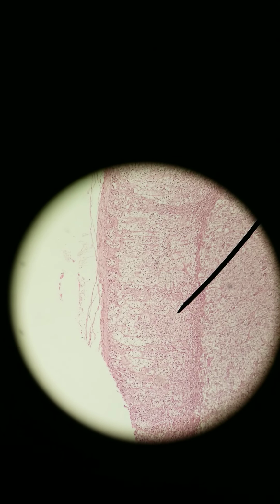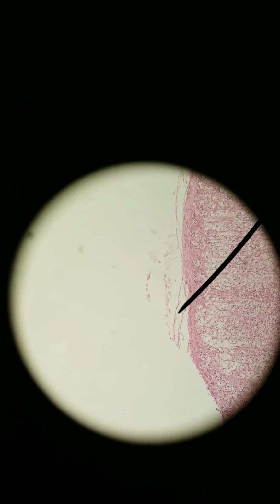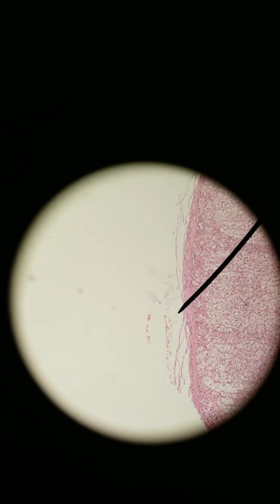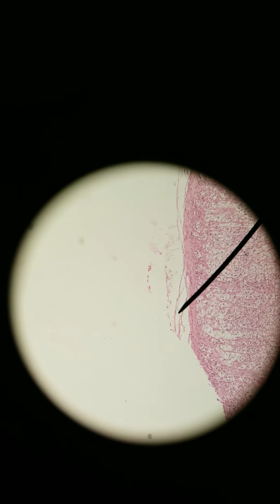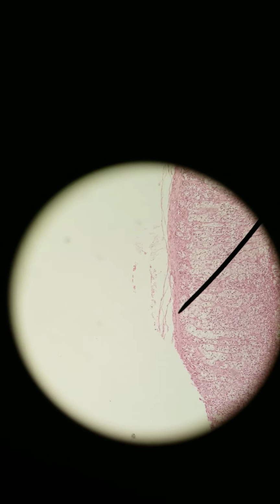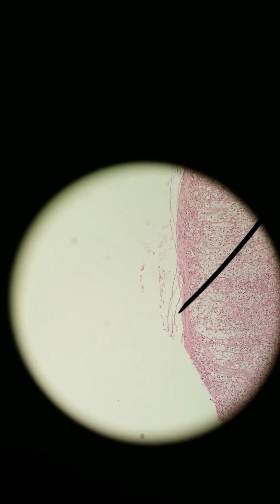In the adrenal cortex, we've got 3 layers. Well, actually, let me back up. The very, very flaky outside, well, it looks flaky because it's been cut, but this protective outer layer, that's the capsule. If you feel a whole kidney, it's a bit dense. We have reticular fibers in the kidney that keep it dense.